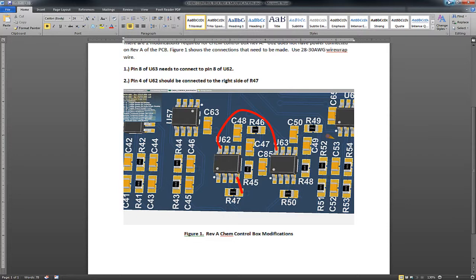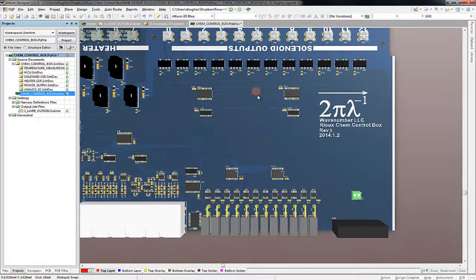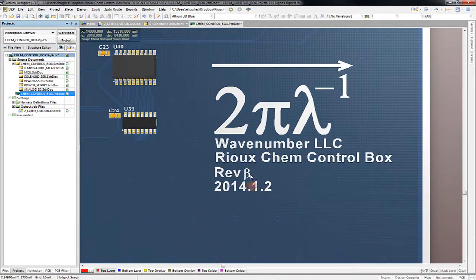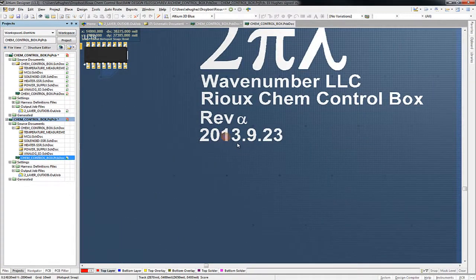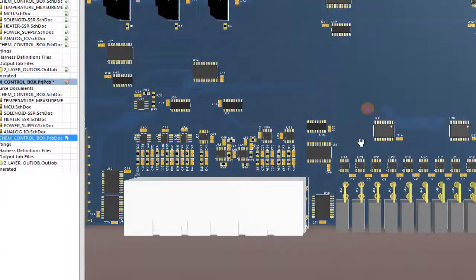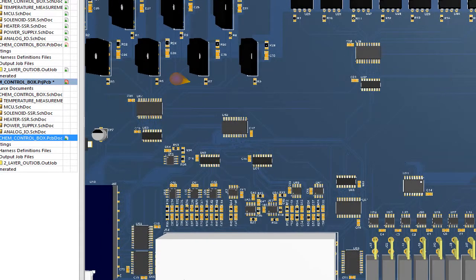The way you're going to know if you need to make the modification is on the circuit board, Rev Alpha or Rev Beta. This shows Rev B for Beta, but this would say Rev A or Rev Alpha. So actually, let me bring it up here. On the Rev A, it has this date code 2013-923 Rev Alpha. That's the version you have to apply the fix to. And basically, what happens is one op amp, just on the schematic, the power was never hooked up.